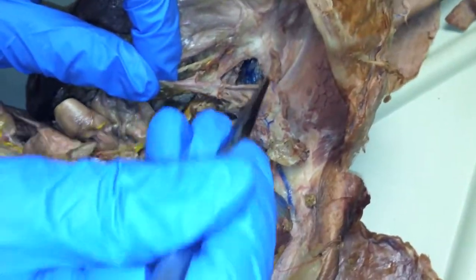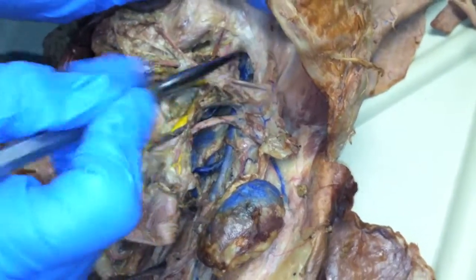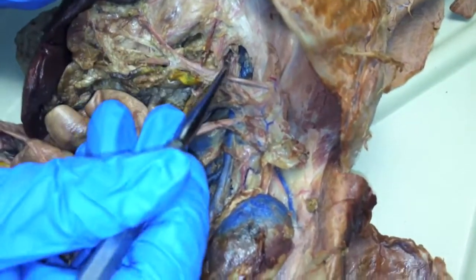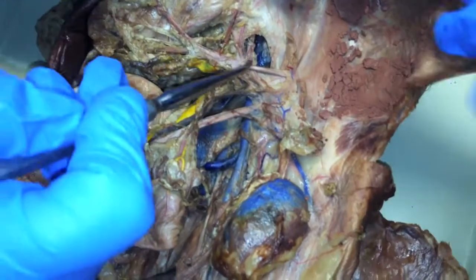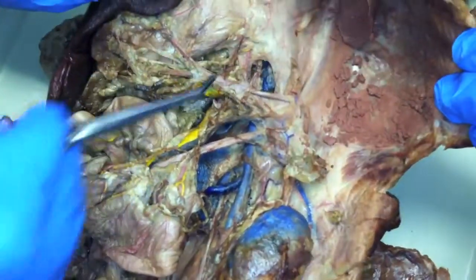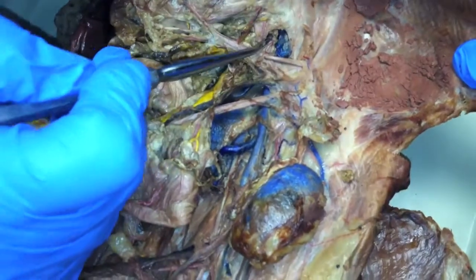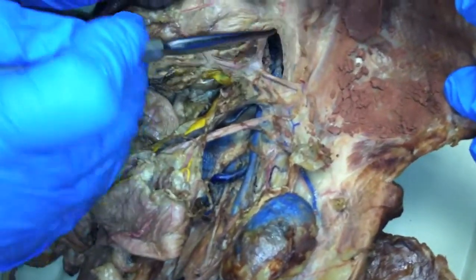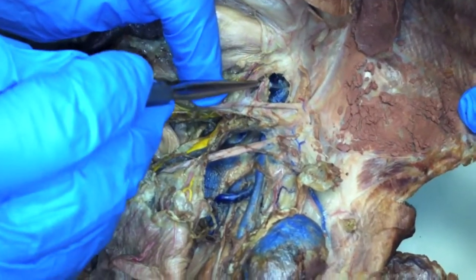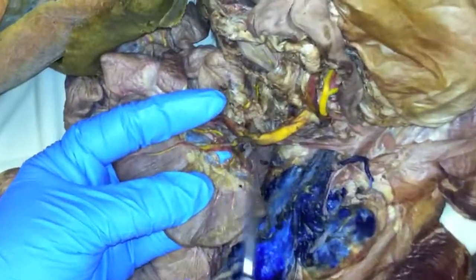So the hepatic is going to go deep. And I think it's this one here. There's one right there, because then there's another one next to it here. So this looks like hepatic is under here. And then this is left gastric next to it. This is just a straight gastric. And then we're into our spleenics. So the left gastric and the hepatic are just real close to each other here. You can see this coming off right there. And that's got to go deep — it goes up under here to the liver.